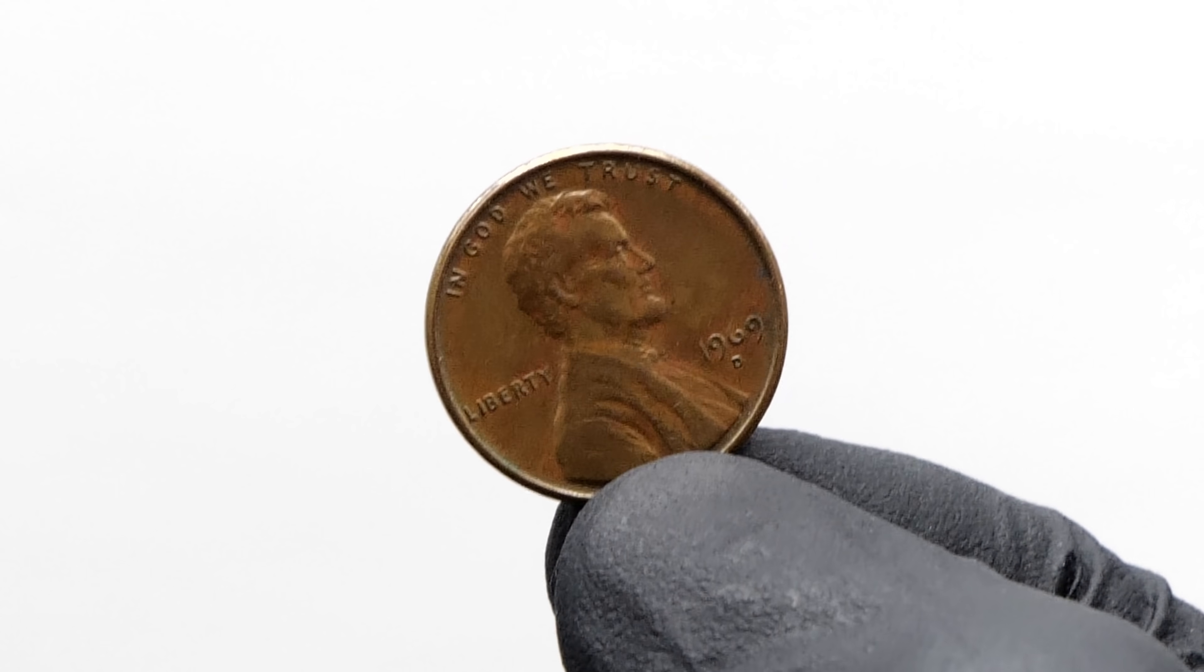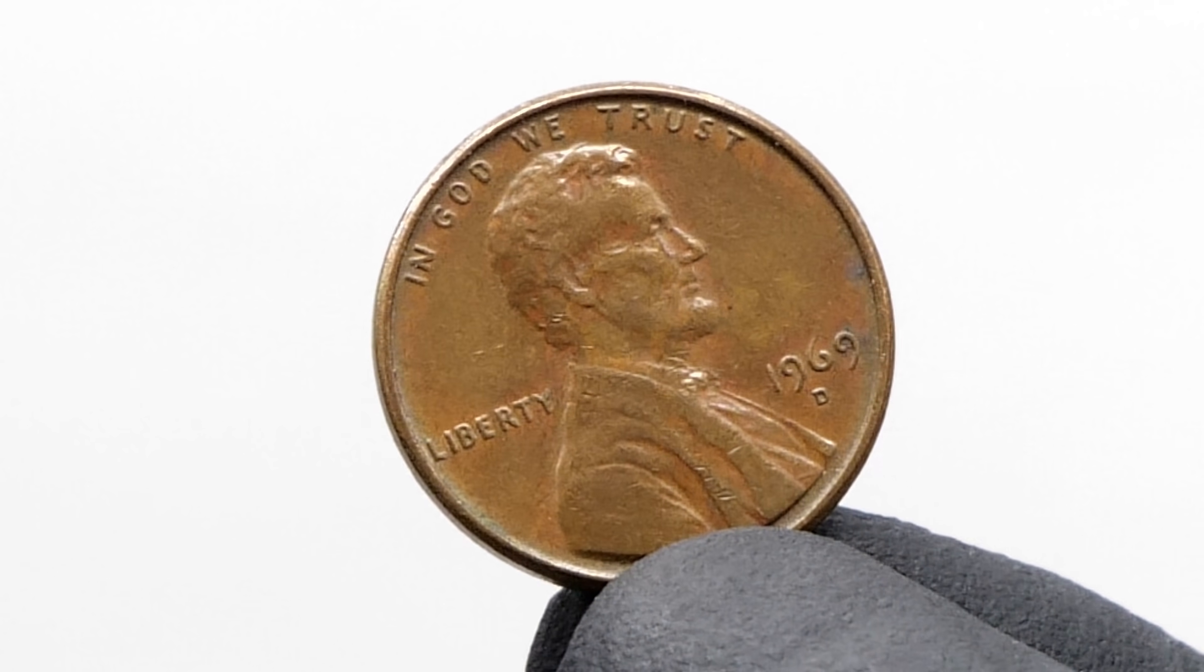For this video, I'm going to try turning this penny into gold, which is something that I've always wanted to do.